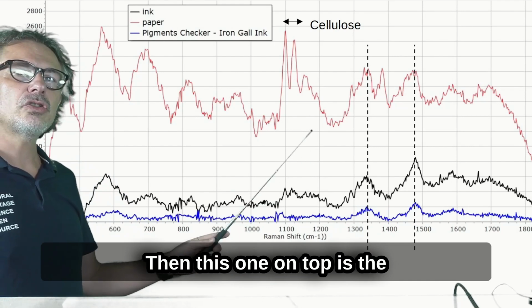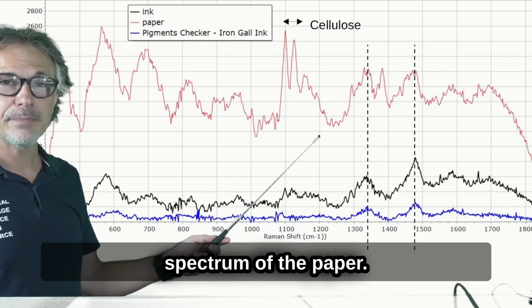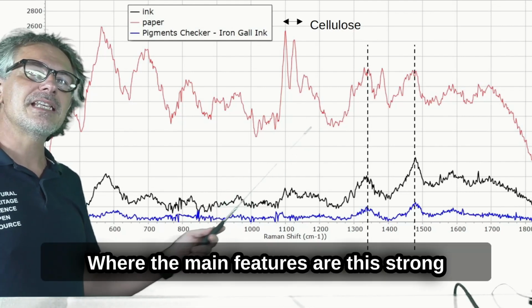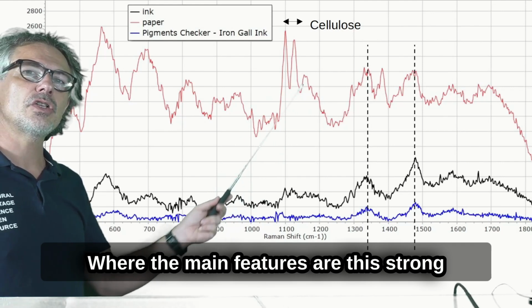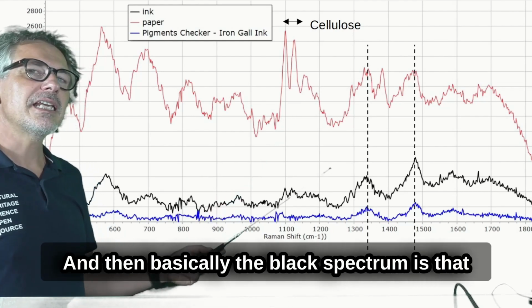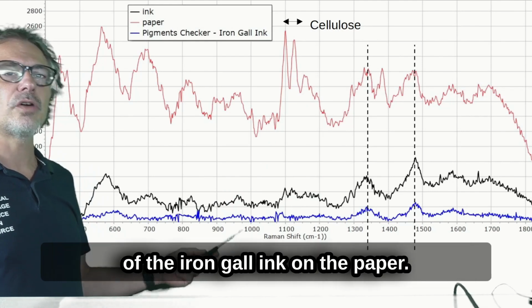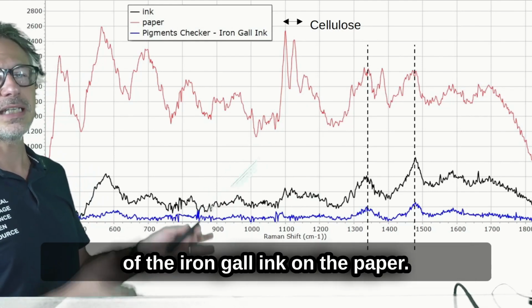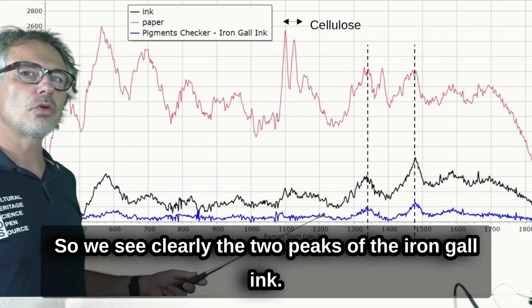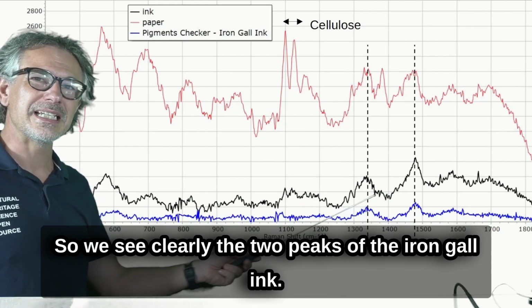Then this one on top is the spectrum of the paper, where the main feature is this strong peak of the cellulose in the paper. And then the black spectrum is that of the iron gall ink on the paper. So we see clearly the two peaks of the iron gall ink.